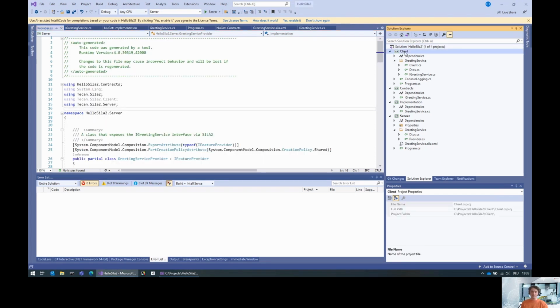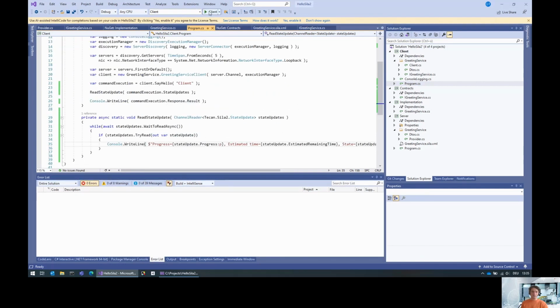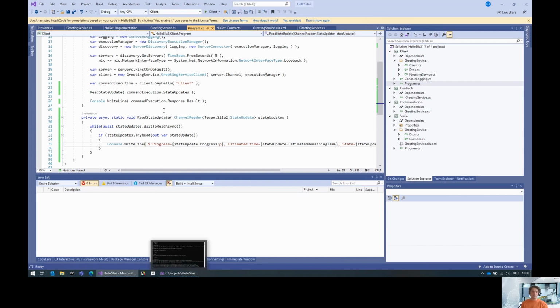Now it is starting, and then we go to the client, set it up as a start project, and run the client. And then we take a look at the console output. So here we get a response that the progress is actually 0. And after 10 seconds, we will get a second message that the progress is 50%, and we'll probably have an estimated runtime of 10 seconds.